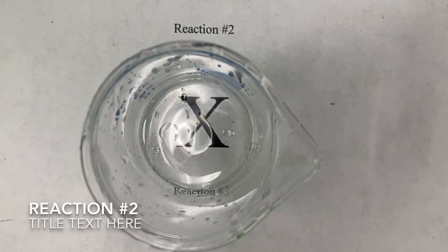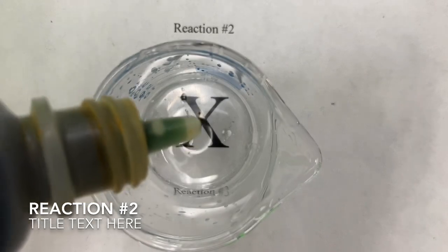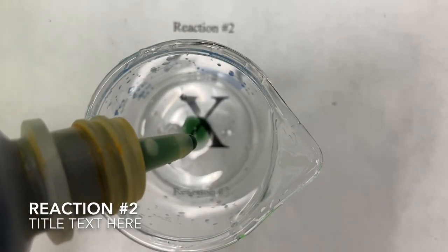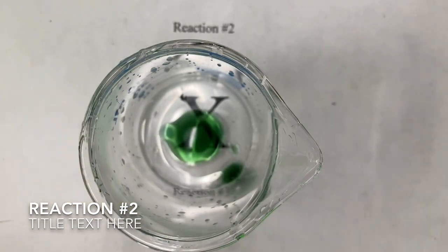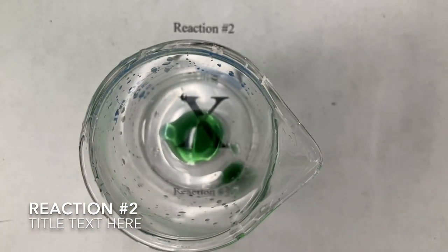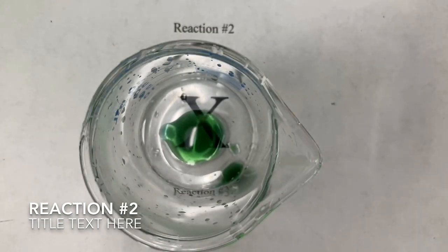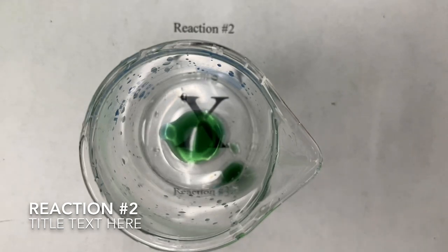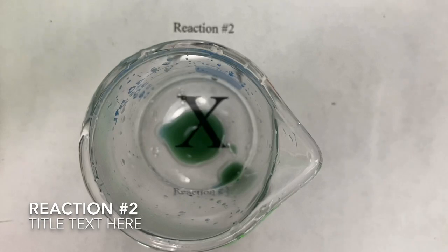All right, for reaction 2, we're going to start with that BTB again. So here's that BTB. This chemical, again, starts as this kind of greenish color. And for reaction number 2, I'm going to add ammonia. Ammonia should react with my hydrogen here. So really it's taking away hydrogen, the same effect as adding the hydroxide ions.